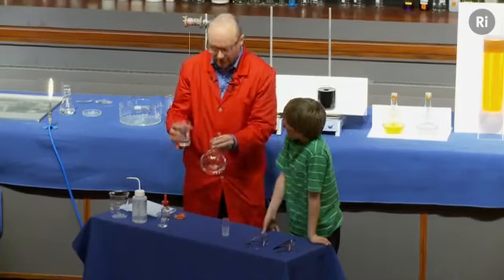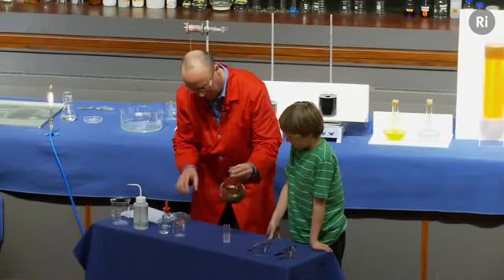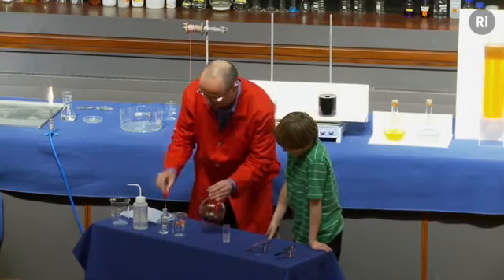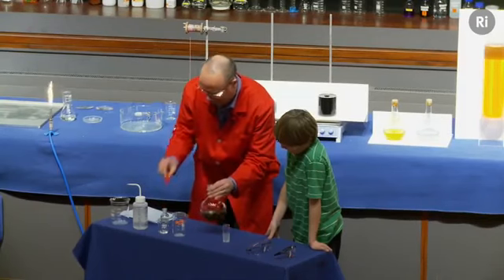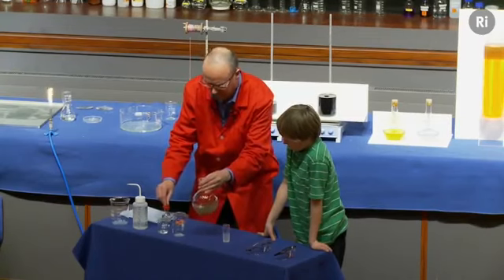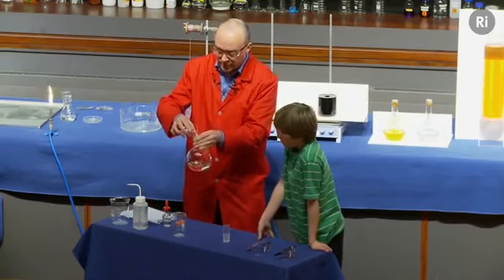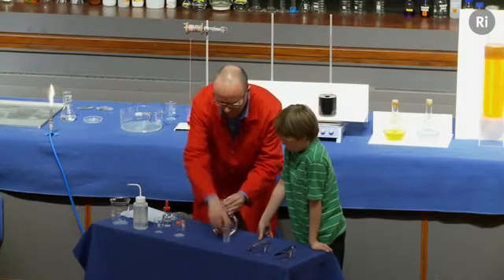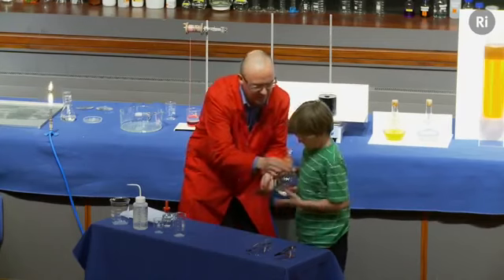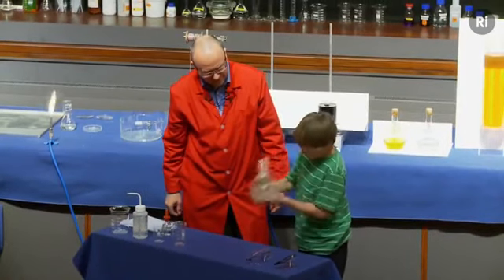Now what I'm going to do is add some sodium hydroxide. That's now formed a very dark brown, almost black material. So I'm now going to add more ammonia. Again, I'm going to add ammonia until the liquid goes back to being colourless. This takes a moment or two. There we go. And then finally, I'm going to add some glucose. So there's the glucose. Now I'm going to put the lid on, put a clip on. I'm going to give it to you, Dylan, and I want you to hold that and give it a really good shake. That's it, really hard shake, that's good. Keep shaking.